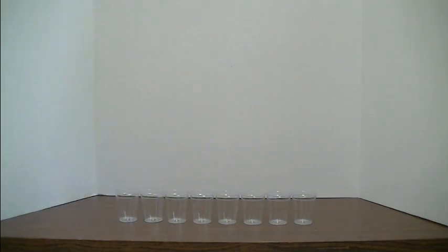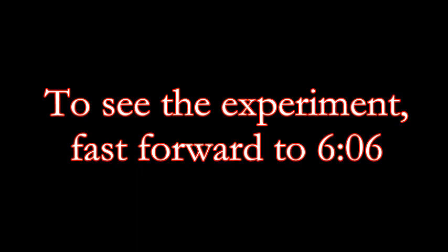Alright, I'd like to describe to you how you can do this experiment where you pour a rainbow out of a single graduated cylinder using the concept of density.